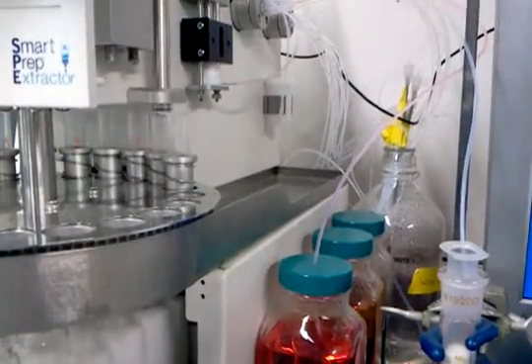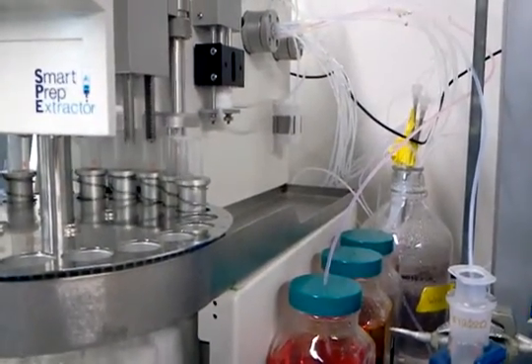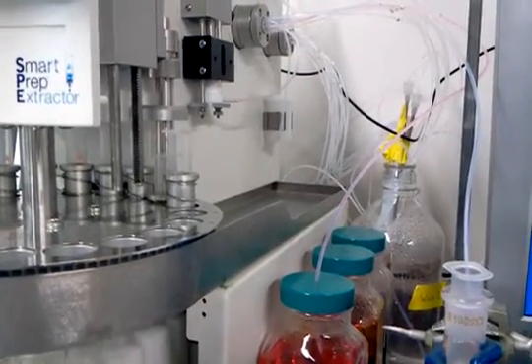For this demonstration, we're using a Smart Prep to pull one mil of sample and deliver it to the head of the SPE column.